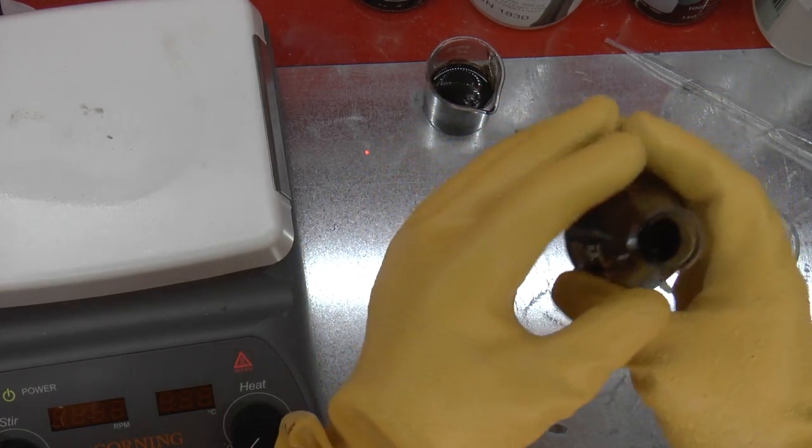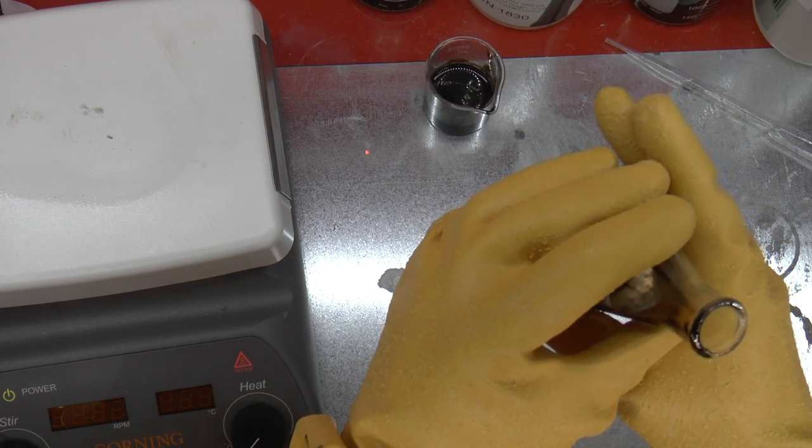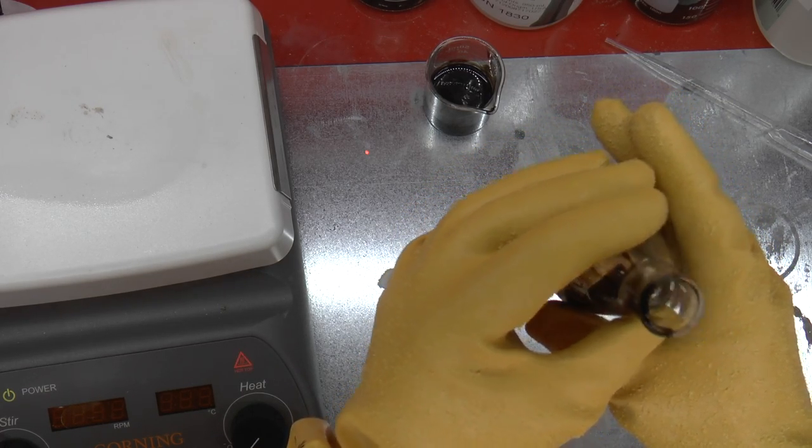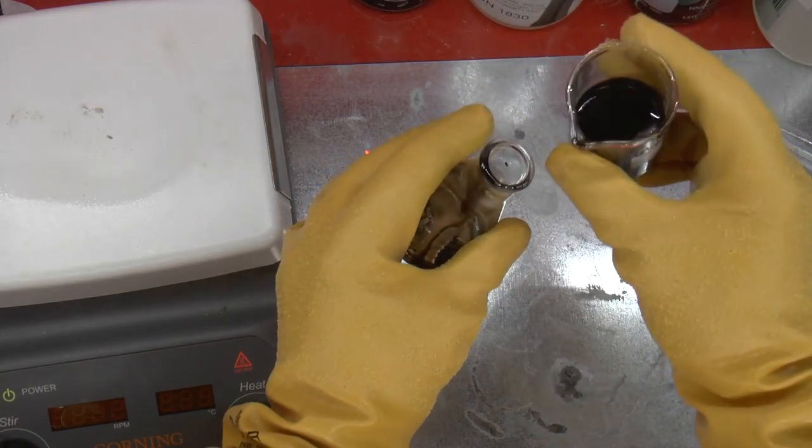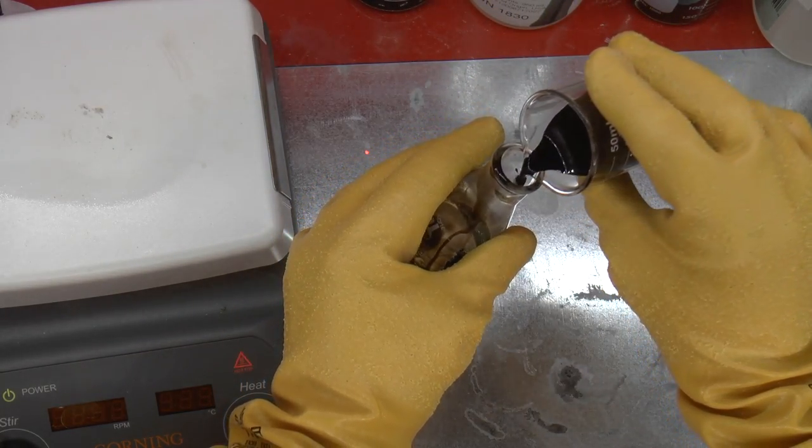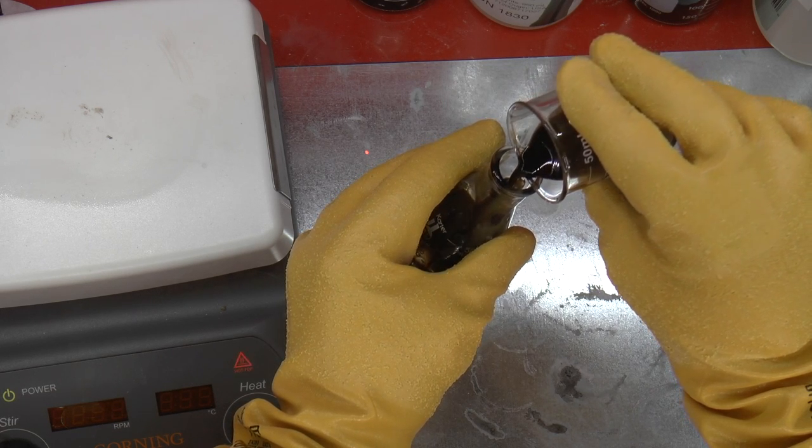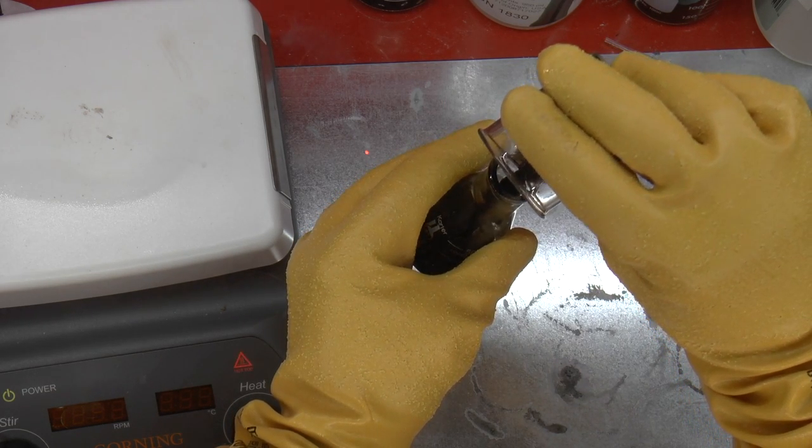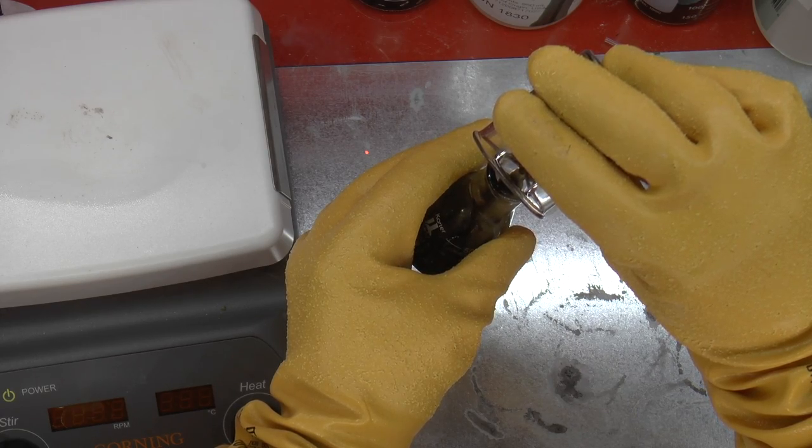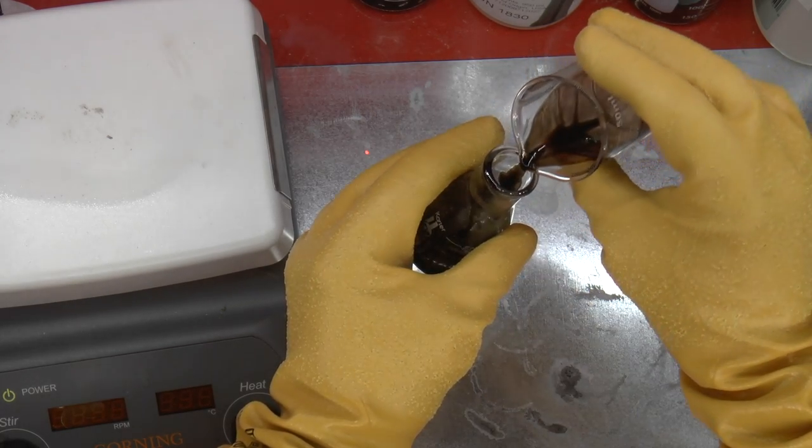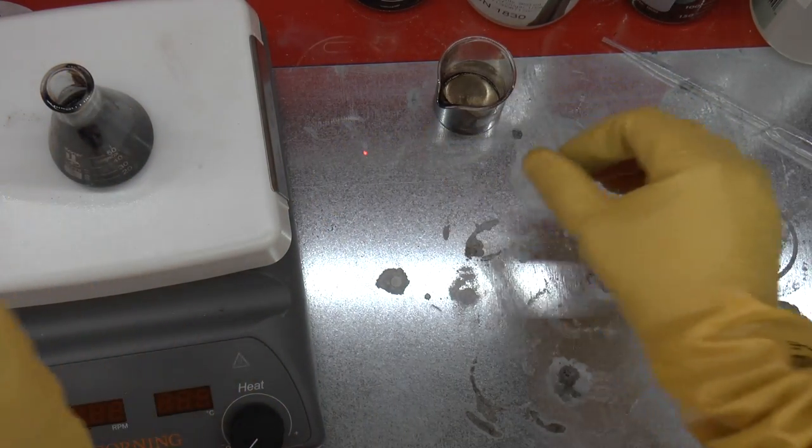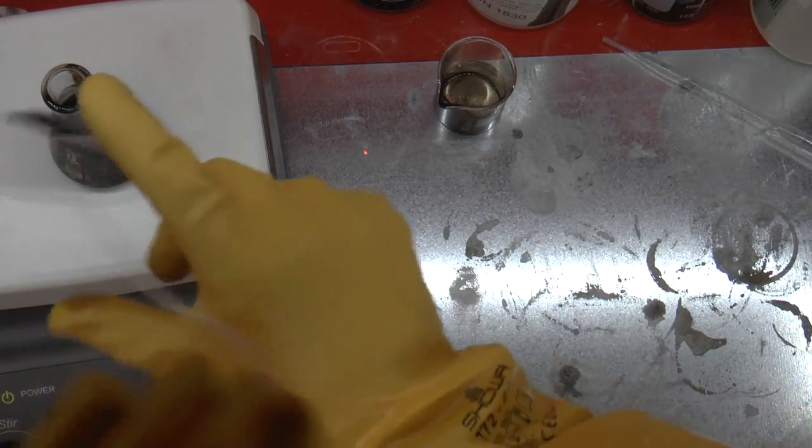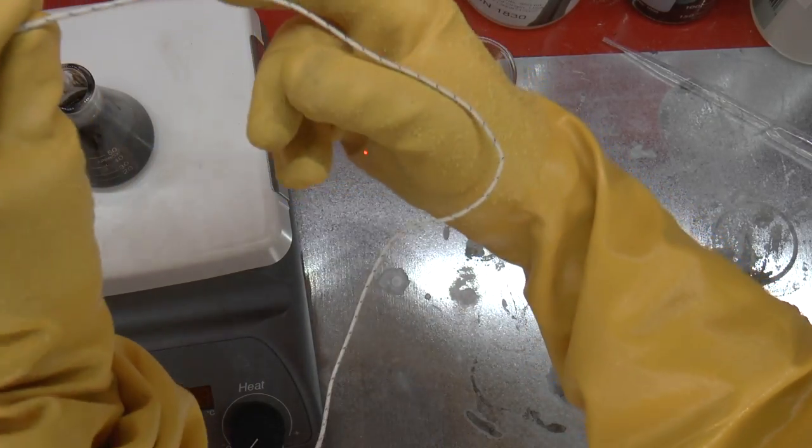Unfortunately you can't see it because the chip is black and the residue is black. So basically what I'm going to do is, I'm just going to put the acid, which is perfectly fine, it's just got some carbon in it, right back into the beaker. I'm going to heat it back up to 200, and then I'm going to leave it for 10 minutes, as I usually do when I do this sort of thing.